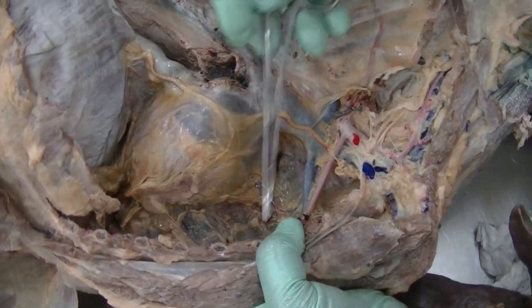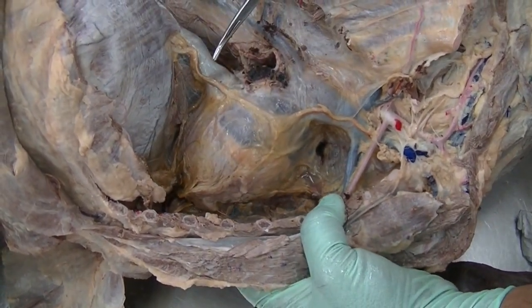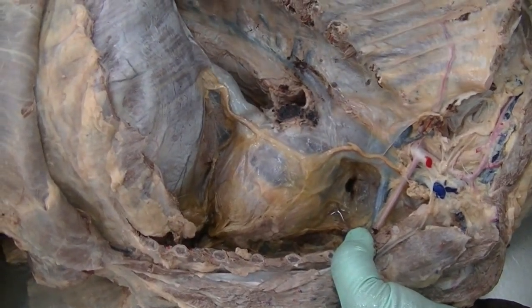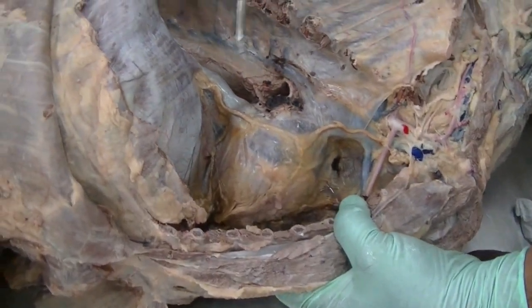So here we have the right thoracic cavity completely separated from the left one by means of the mediastinum, and in the right thoracic cavity we do have another compartment which is connected to the rest of the cavity, that is your mediastinal recess, which occupies the accessory lobe of the right lung.